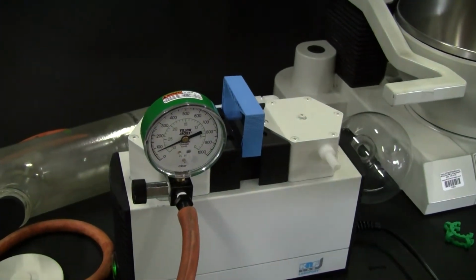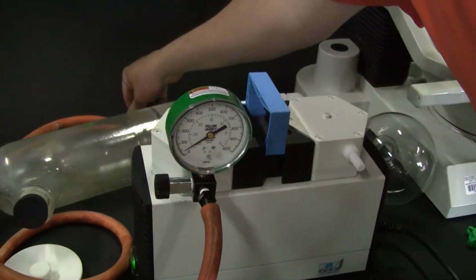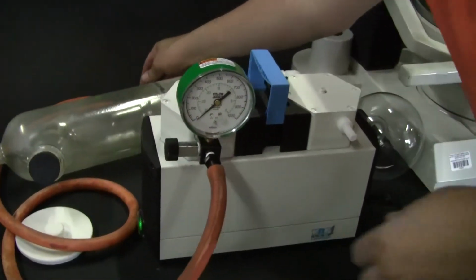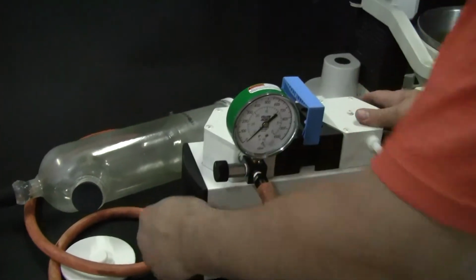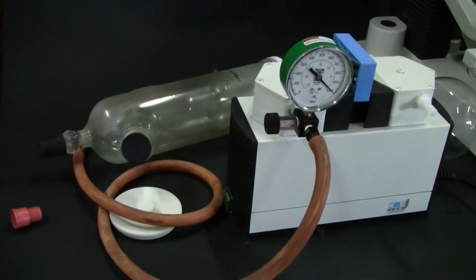If I wanted to do a prolonged test, I could actually just adjust the vacuum not to go into the chamber anymore. Actually shut the vacuum pump off. I can release the vacuum here. And you can see the cold trap is still holding vacuum.